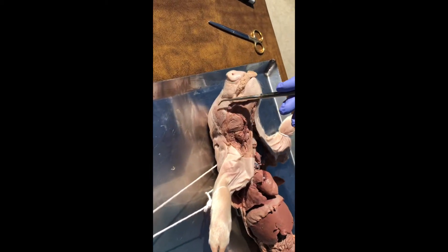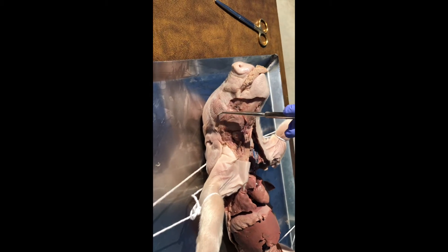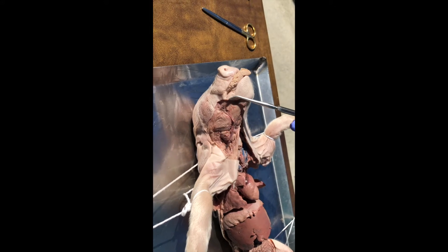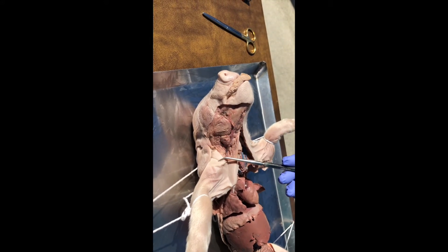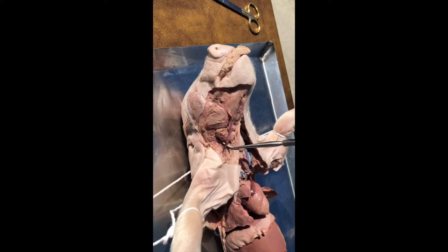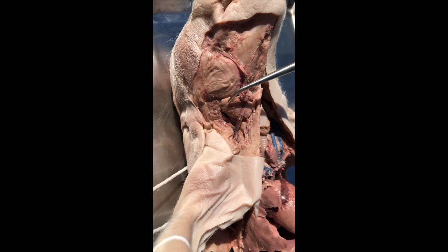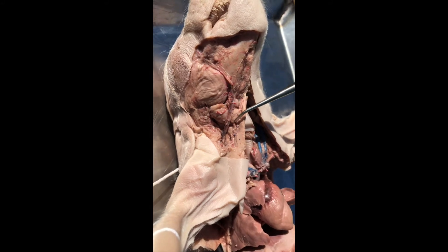This is a pig that has — here's its eye — its eyelids are intact, so you can see this is a really superficial look at the face, with just having some skin removed. That lets us see this is a facial vein right there, so I don't think that's in any of your assignments, but it's a good reference point.